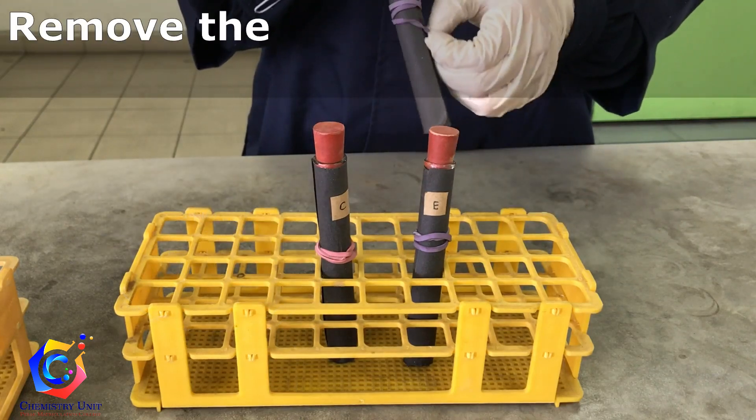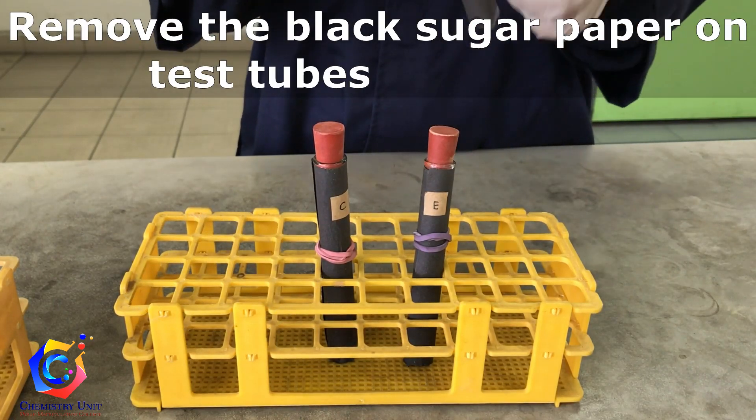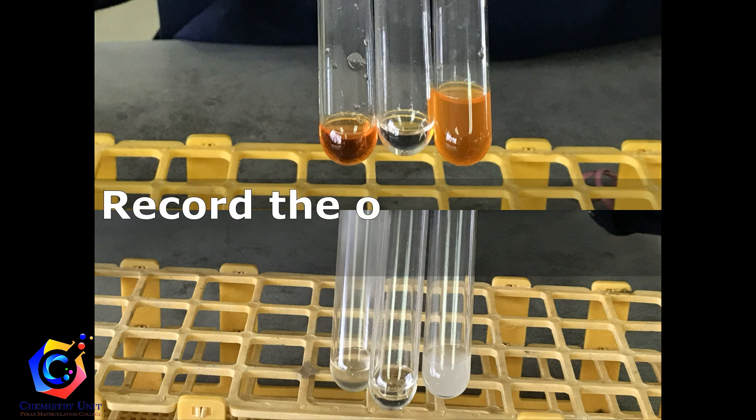Remove the black sugar paper on test tubes A, C and E and record the observations.